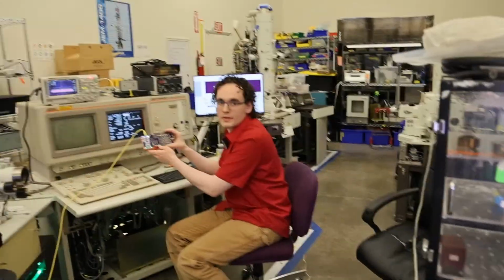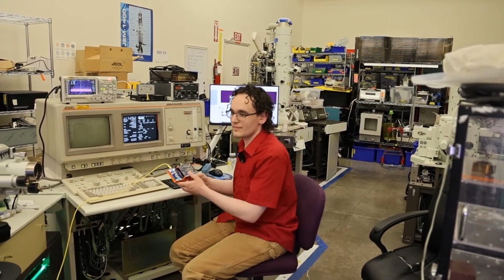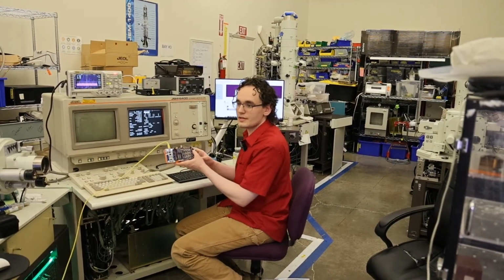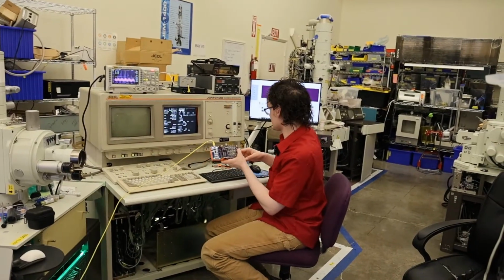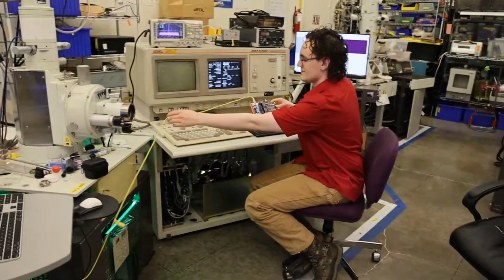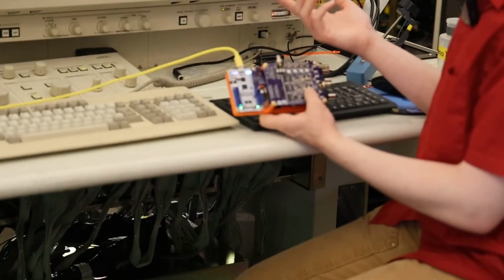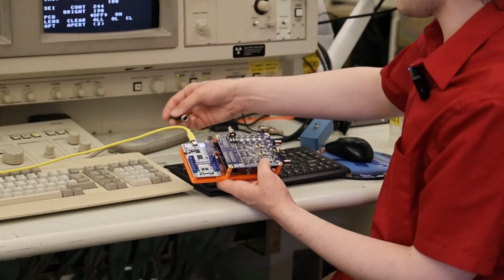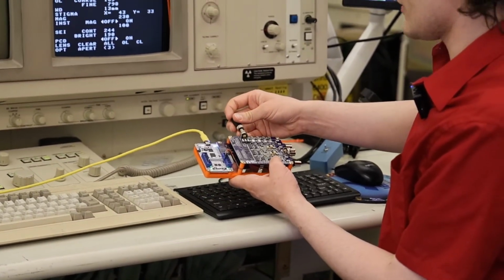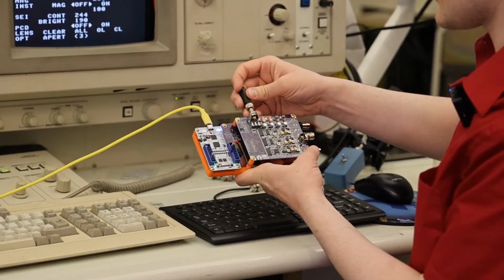So we've got OBI right here. And then if you want to zoom in on it with the lens, we plugged in 4 cables in the back. We did power, detector, and our X and Y. So let's go ahead and plug power in. I don't always necessarily recommend just hot swapping power, but it has been extensively tested, so we can just plug power in.